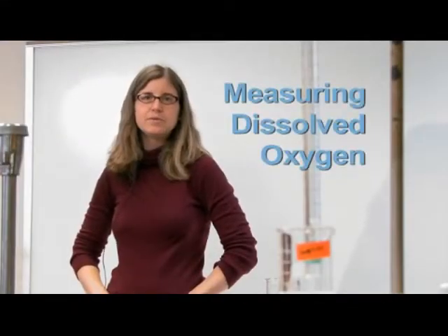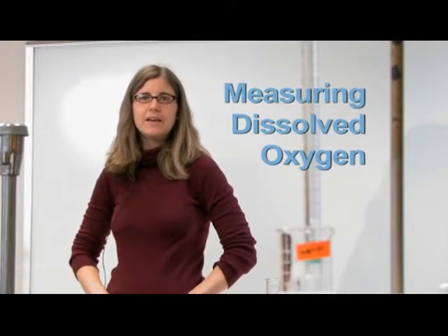Hello, my name is Christine Moot. I'm from the North Carolina School of Science and Math, and I'm going to demonstrate how to measure dissolved oxygen.